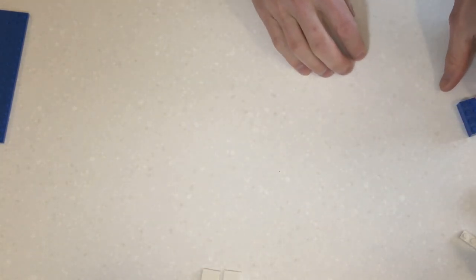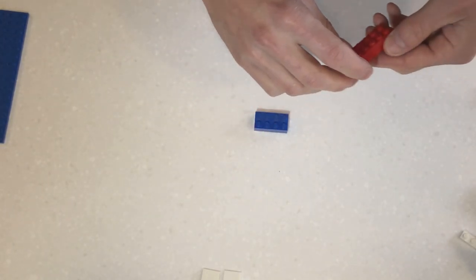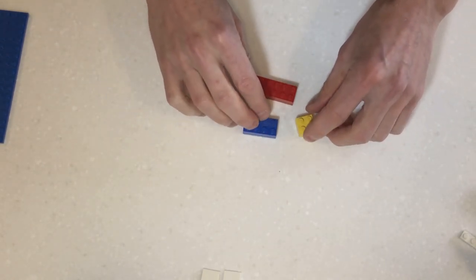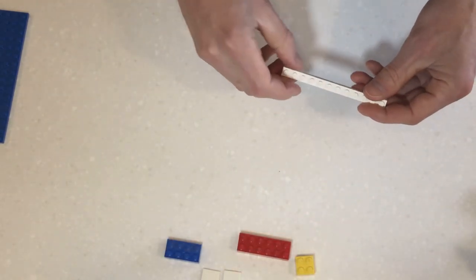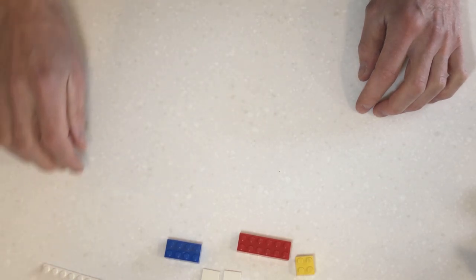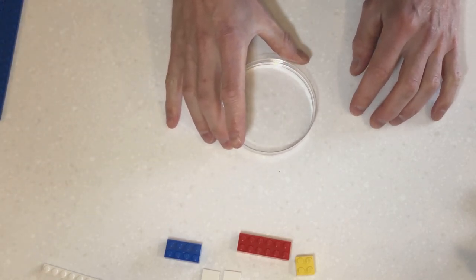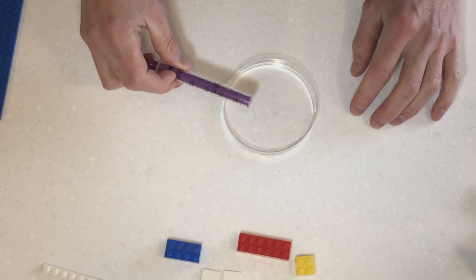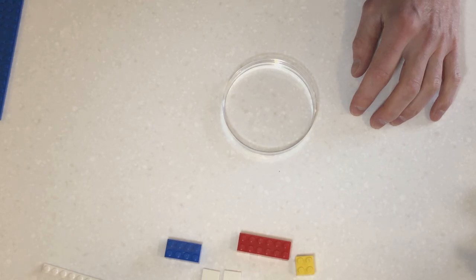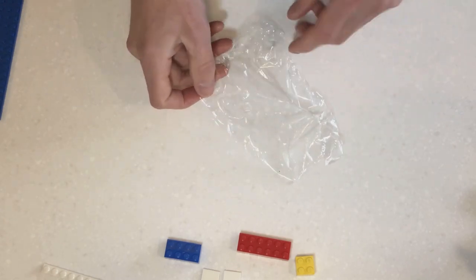We're going to need to build the body of the microscope. This can be done through these type of Lego bits, this being a 4x2, or a 6x2, or a 2x2. They're the thick types of Lego bricks. You're also going to need something long and thin, preferably something like this, to move your sample around. Okay, we're going to need some water. This will form our lens and a device to drop that water onto the cling film. I'm using a little dropper like this. You can also use a teaspoon. And we're going to need a piece of cling film, no bigger than this.